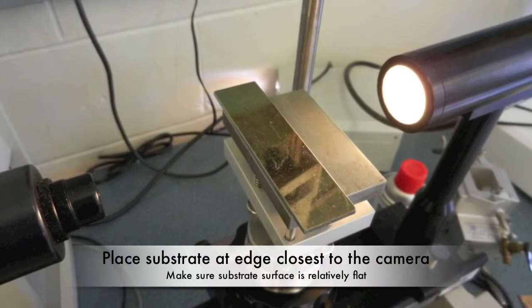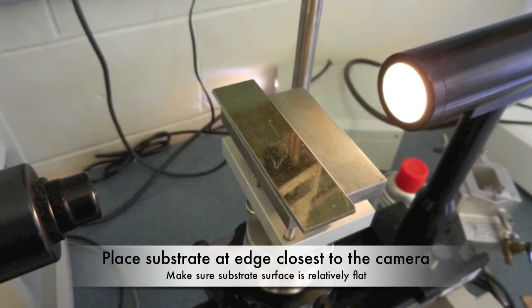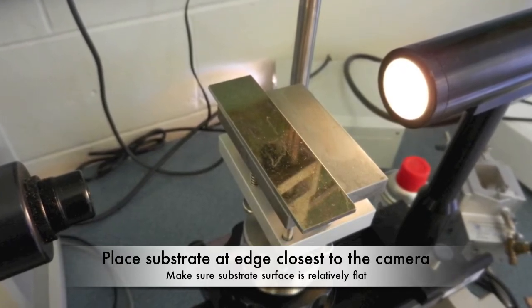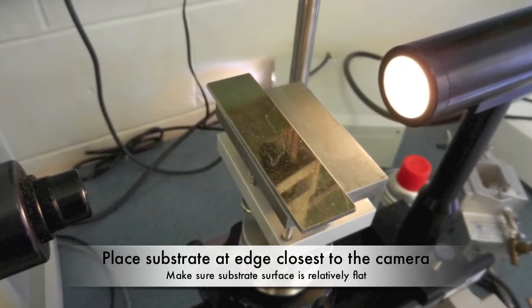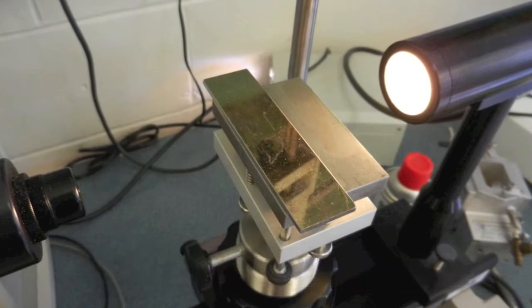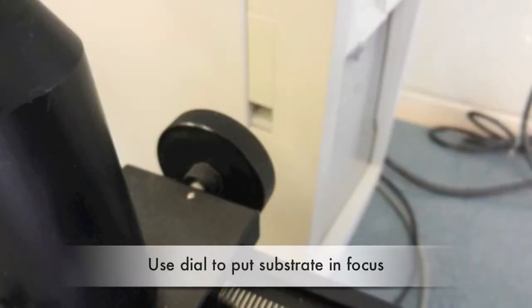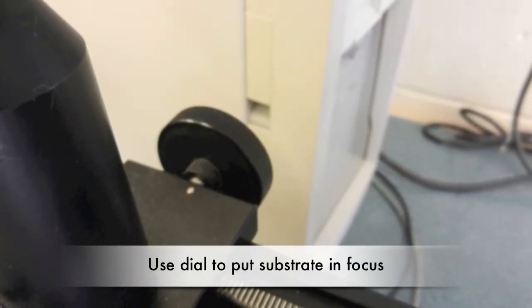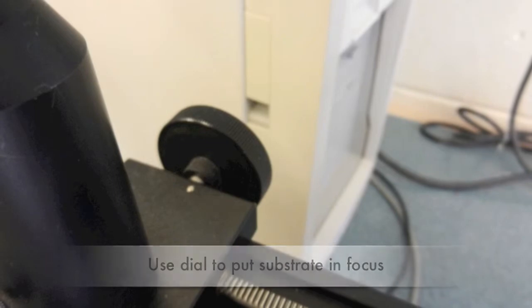Place your substrate on the stage on the edge closest to the camera. Sand the substrate if needed to make sure you have a relatively flat surface for the measurements. Use the dial on the side of the machine to get the substrate into focus on the screen.